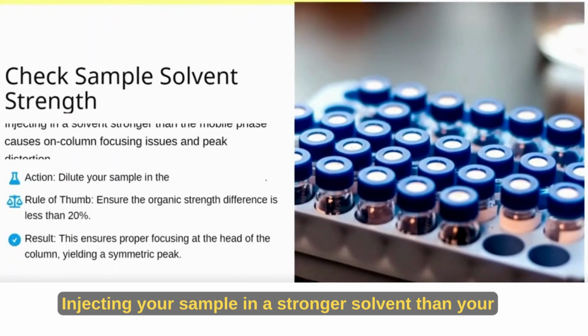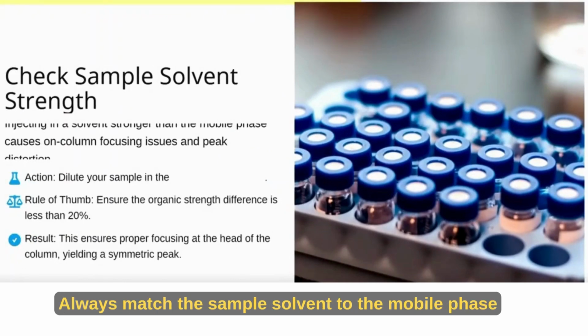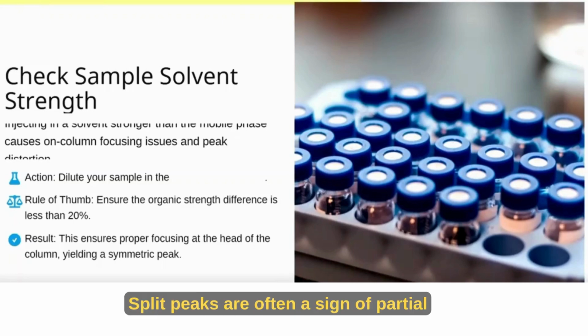Check sample solvent strength. Injecting your sample in a stronger solvent than your mobile phase can distort the peaks instantly. Always match the sample solvent to the mobile phase within 20% difference. Proper focusing at the column head will restore beautiful symmetry.